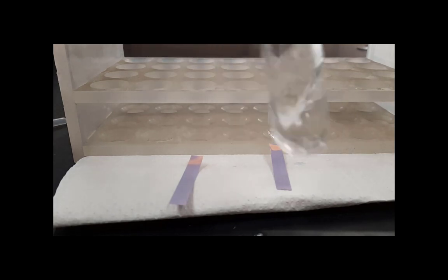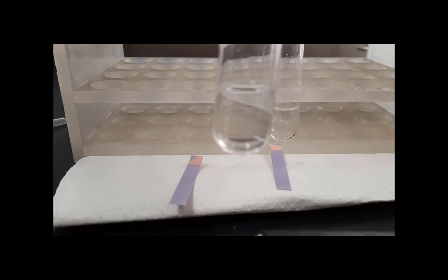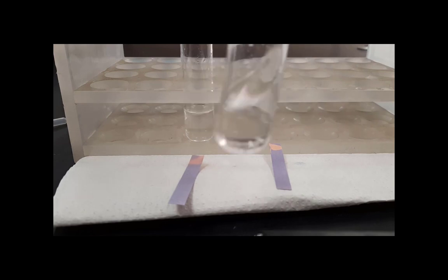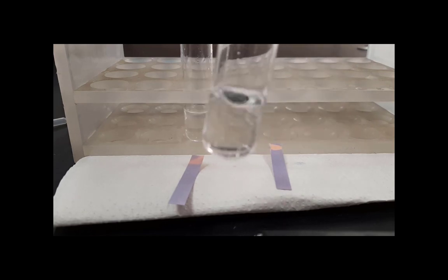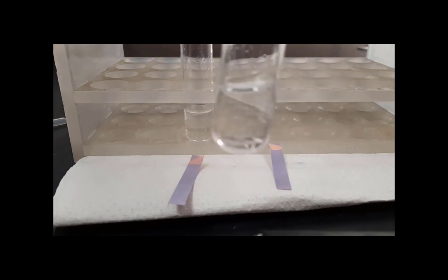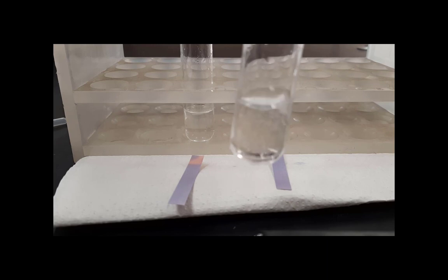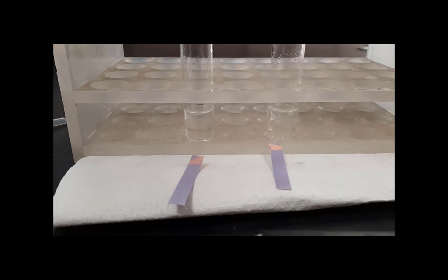So throughout all of this, nothing has visually changed in the acetic acid test tube. However, if you look carefully, the benzoic acid crystals are back. The carboxylate ion is now back to being benzoic acid. That ends part A.